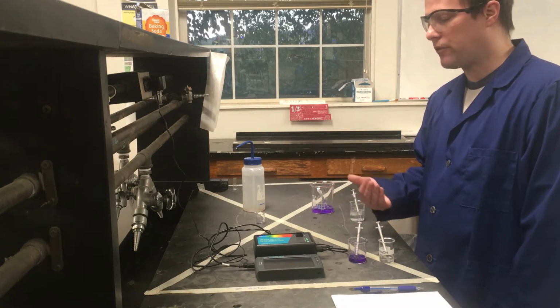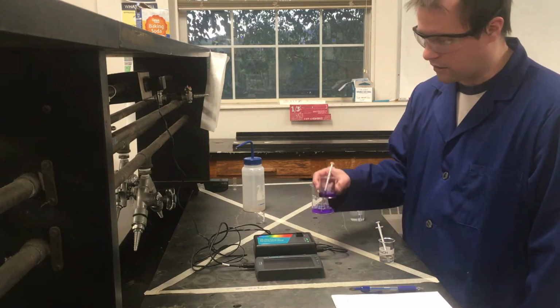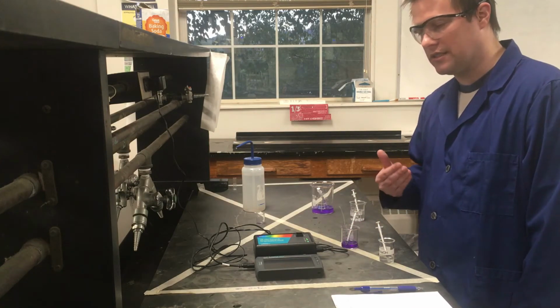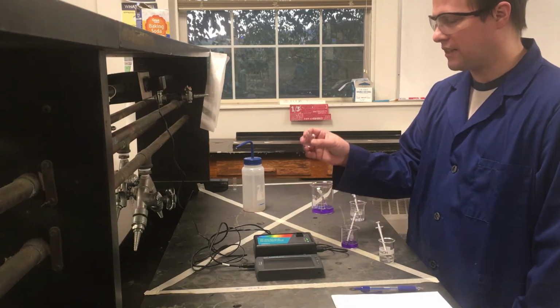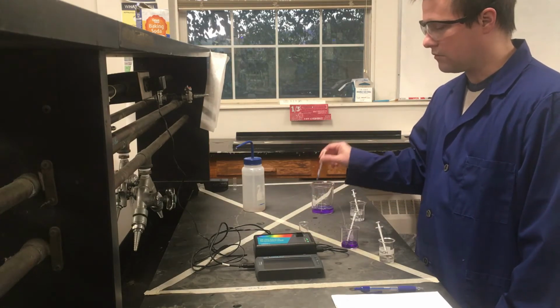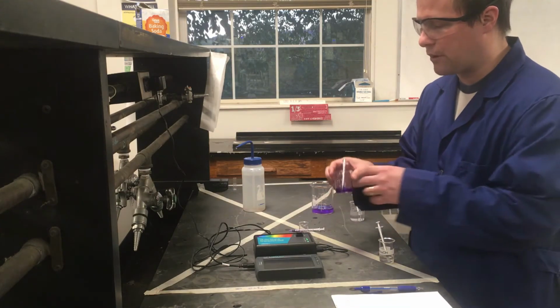And so this last part of our experiment, we actually get to do a chemical reaction where we're going to react our crystal violet, our last bits of our stock solution that we made, and we should actually see its color dissipate over time as it reacts with the sodium hydroxide. So I'm going to mix things in this beaker, and then immediately take the stuff out of this beaker and add it back to our cuvette that we're going to run our experiment in.